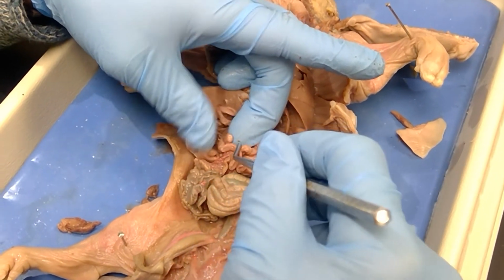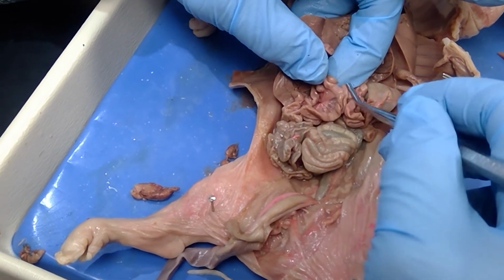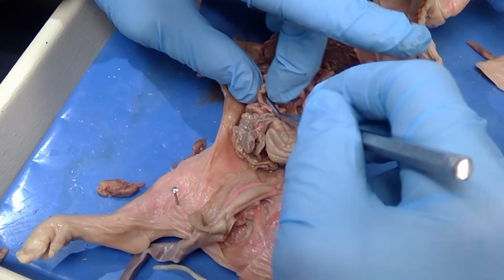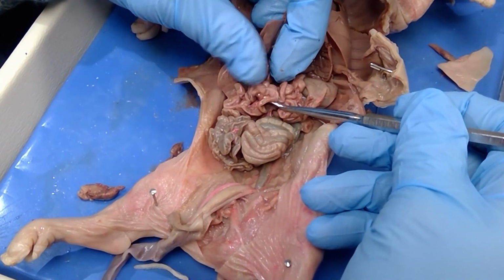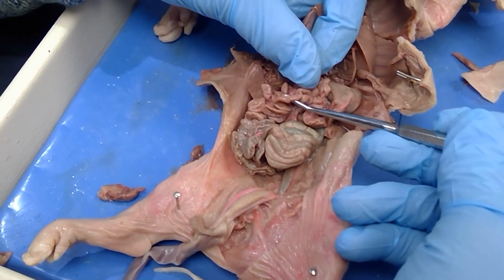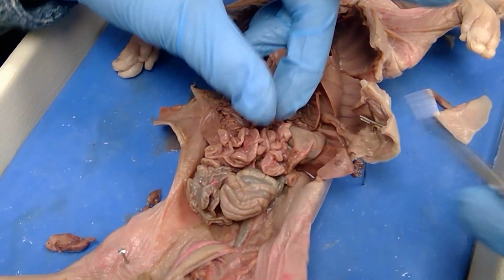Okay, you see your intestines here? Nobody cut the mesentery apart. That's why it's still all curled up and everything. So this right here is mesentery. That clear stuff right there. If you remember fascia, it's the same type of tissue, but it's actually holding the organs together. So if you can see the probe, but kind of see that clearish tissue on the top of it, that's the mesentery. Okay, thank you.